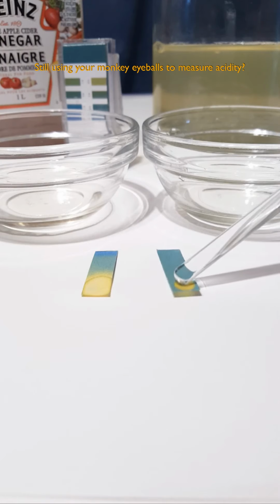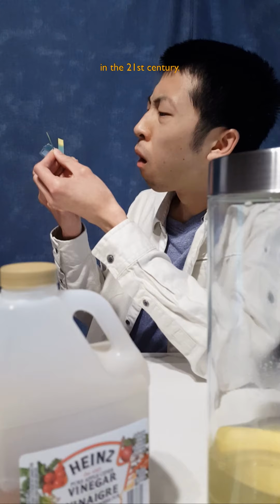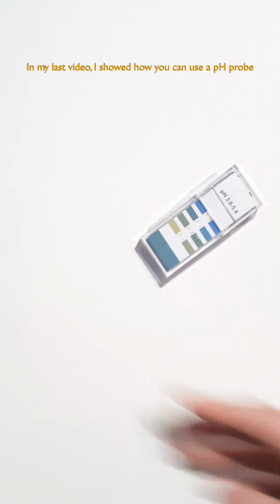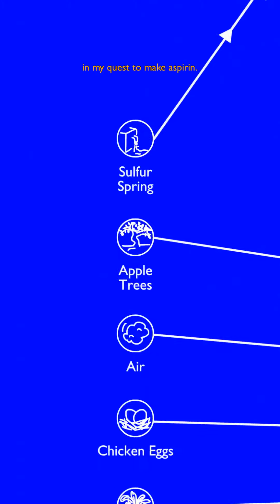Still using your monkey eyeballs to measure acidity? That's no way to do quality control in the 21st century. In my last video, I showed how you can use a pH probe to measure dilute solutions of vinegar when pH papers just aren't precise enough, which will be critical in my quest to make aspirin.